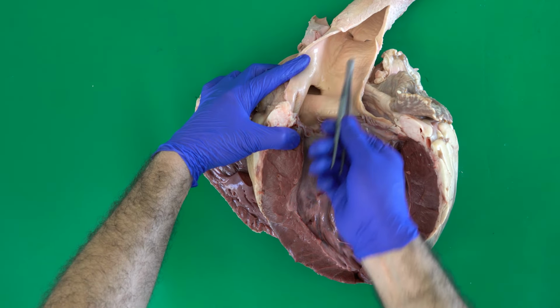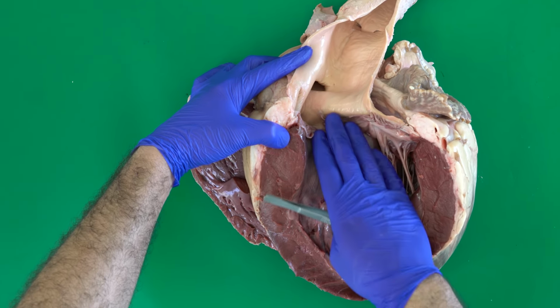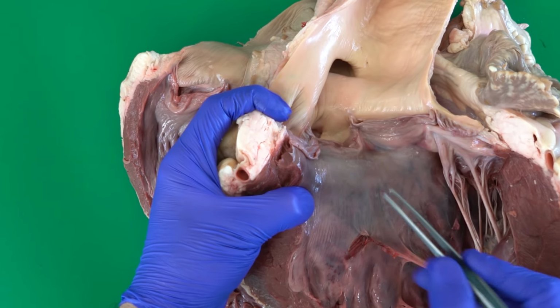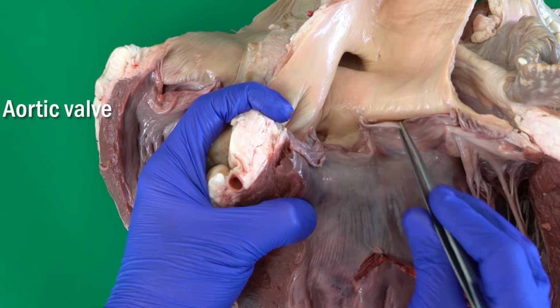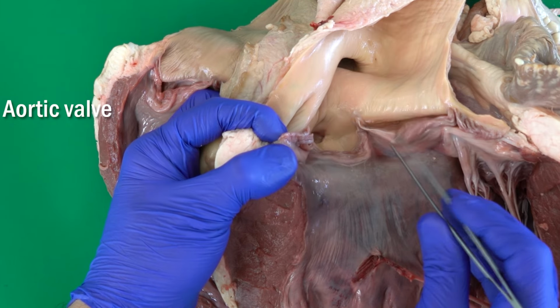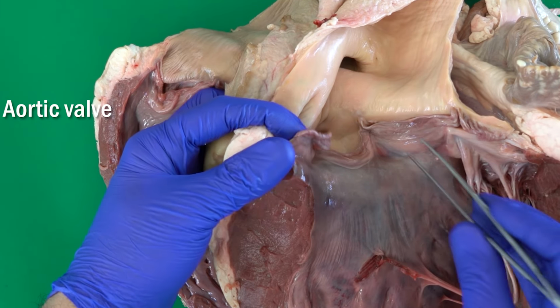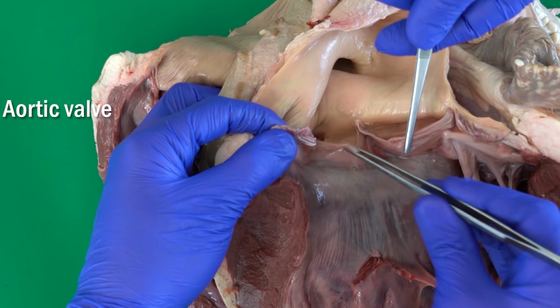I opened also the aorta at this level. The aorta, as we explained before, starts from the left ventricle. And we said that between the left ventricle and the aorta we have another valve. This one has also 3 semilunar valvulae: the left, the right, and the septal valvula. So this is 1, 2, 3.